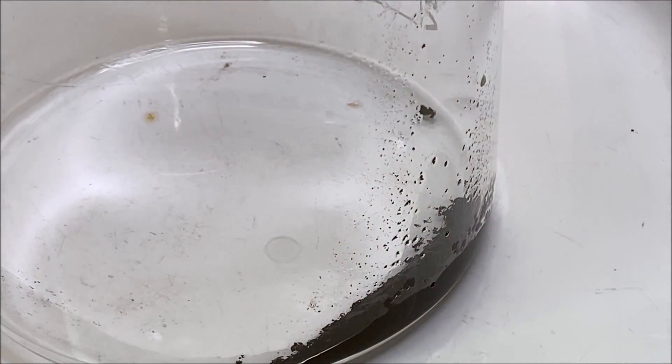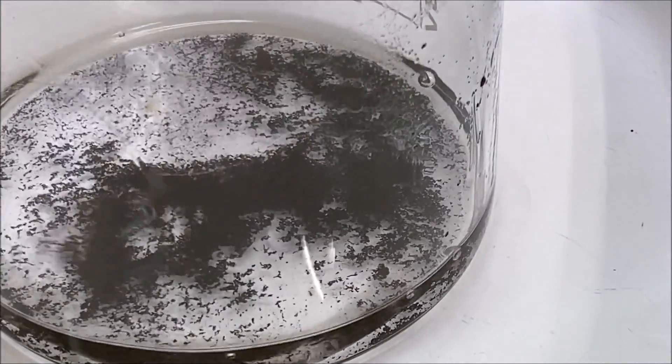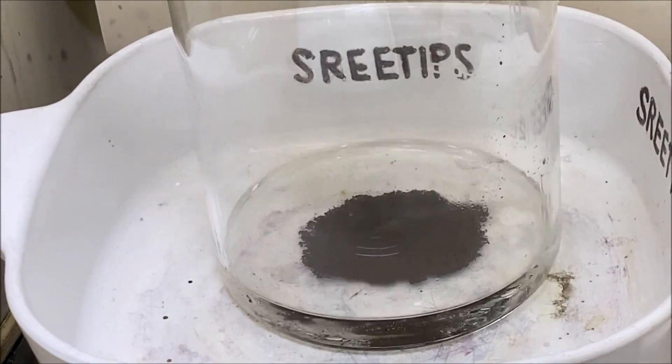All right, here's what we got down inside of our beaker. I'm going to put a little bit of hydrochloric acid on here and we're going to set this up on the heat now.